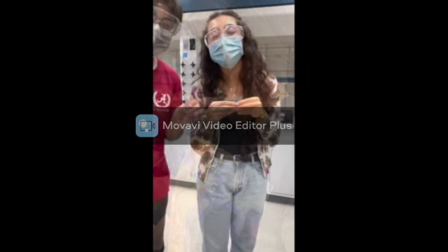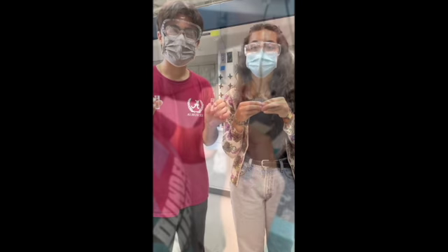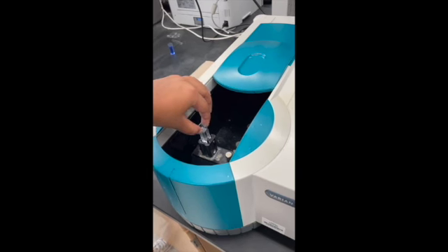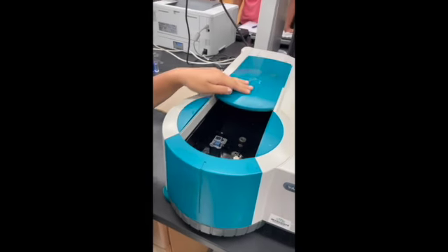We have all our cuvettes. We're going to head over to the spectrophotometer to test the absorbance values. We are now cleaning the two sides of the cuvette with a Kimwipe so that the light may pass through. To start doing our spectrophotometry lab, we're going to first blank out the machine, and then we're going to insert our stock solution in order to scan across all wavelengths.